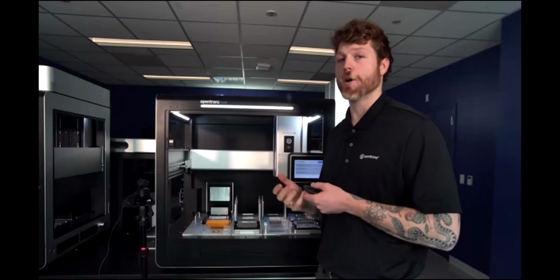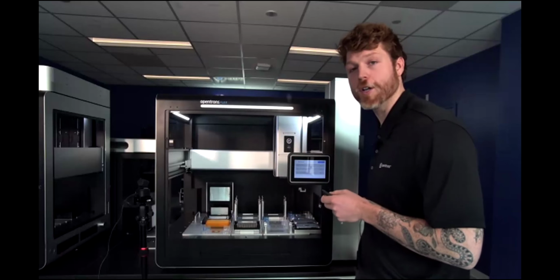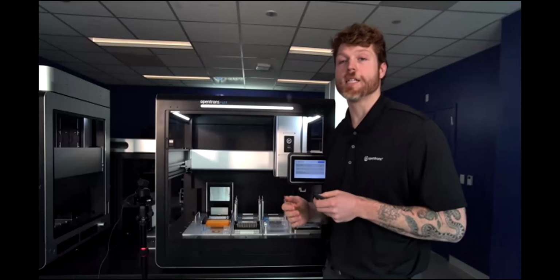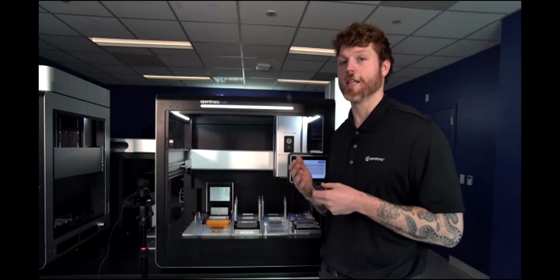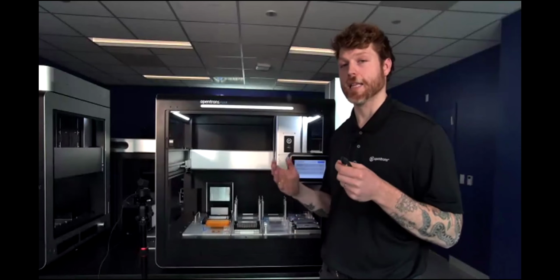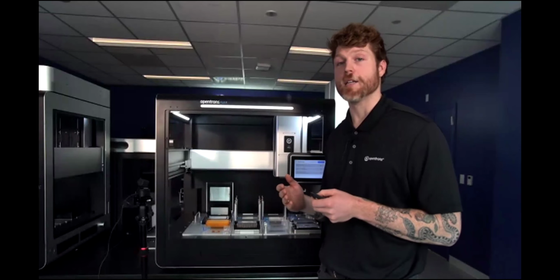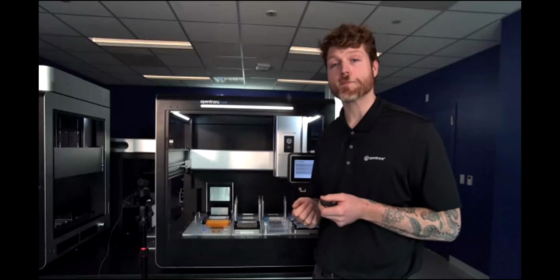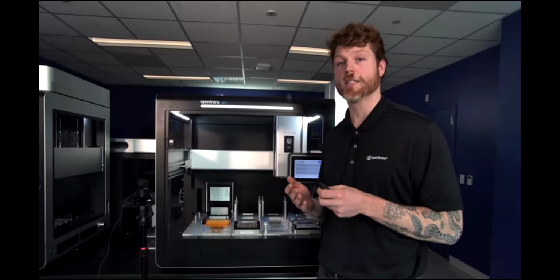They have a very small footprint, as you can see. So they really only add about a foot of distance onto the bench space necessary. And so this means that you have the ability to rapidly and greatly increase how many labwares you have access to in one automated run, without the need of greatly expanding the bench space that you need to have available to you. So this is a fantastic add-on to the Flex system.